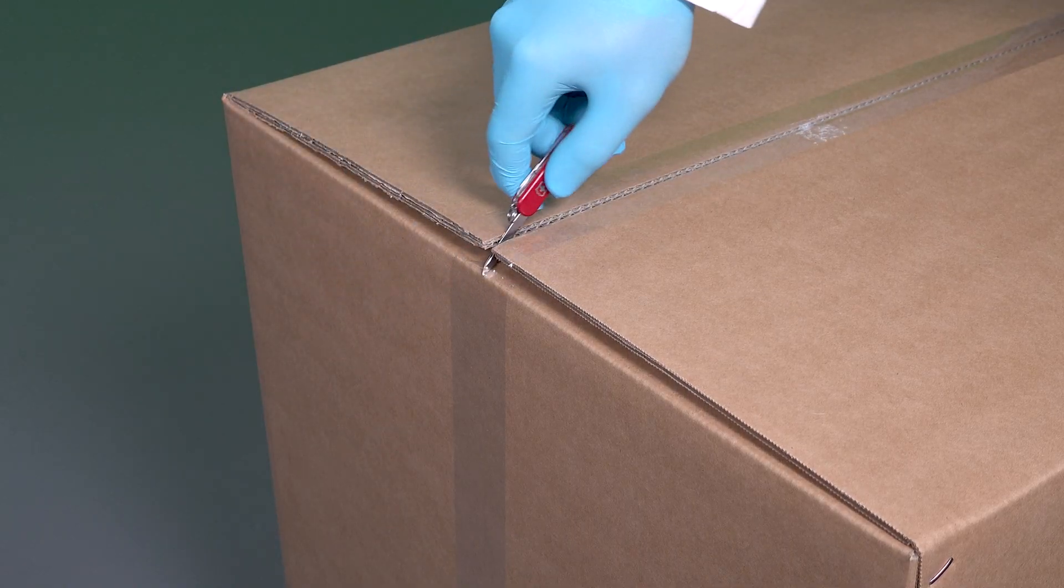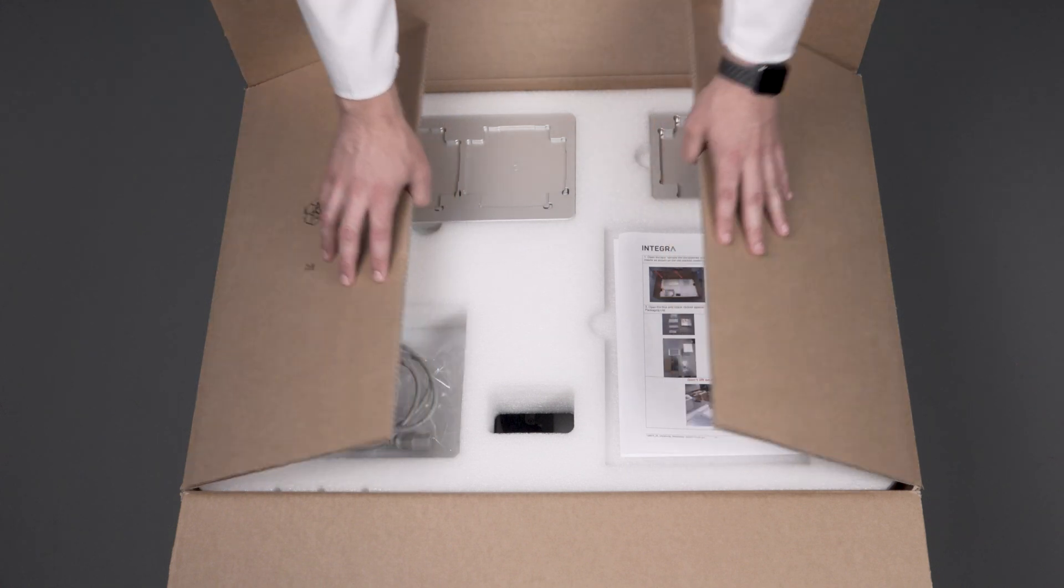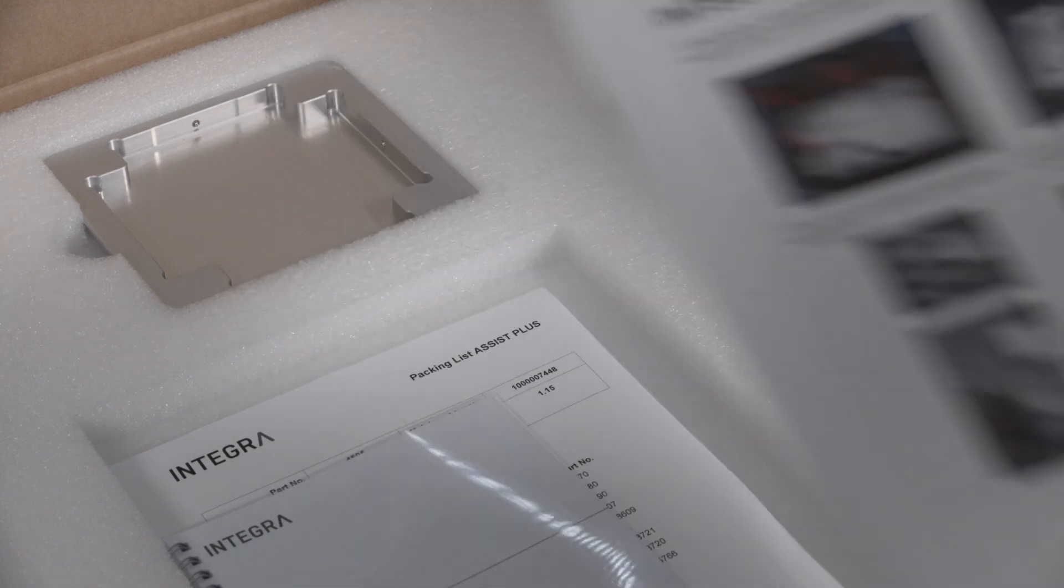Cut the tape on the top and open it. Take out the unpacking and operating instructions.